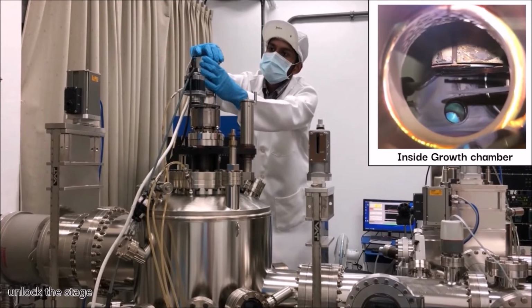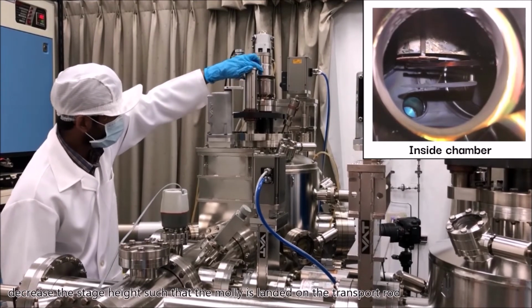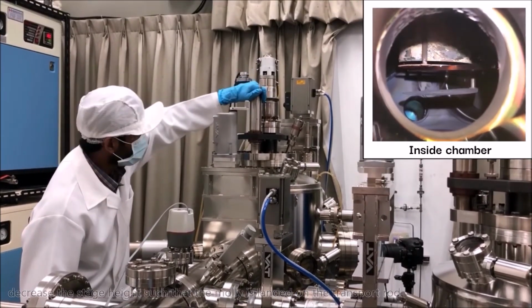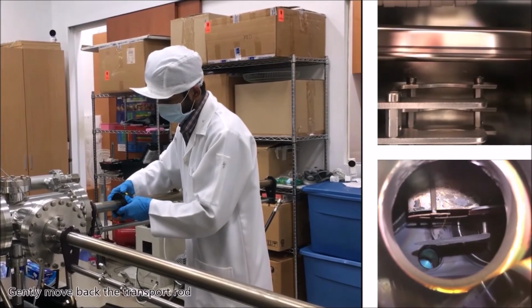Unlock the stage. Decrease the stage height such that the moly is landed on the transport rod. Gently move back the transport rod.